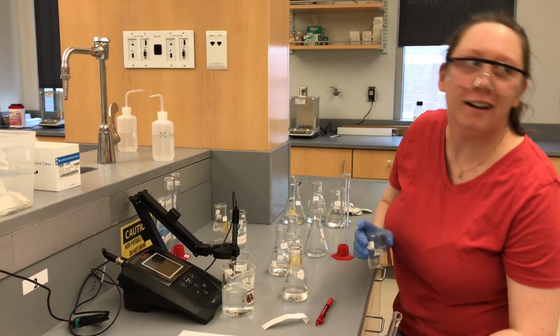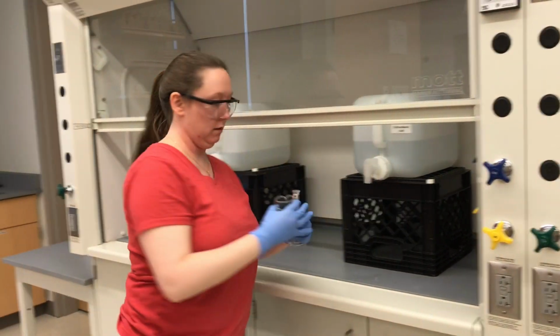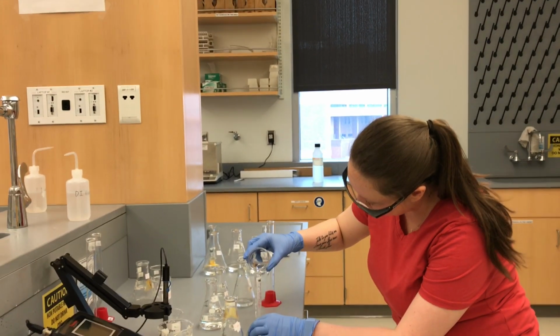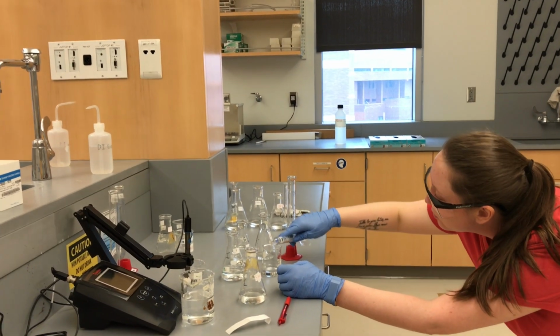Gonna take out a beaker this time. Okay. So our F plus HCl trial. It's a little too much.